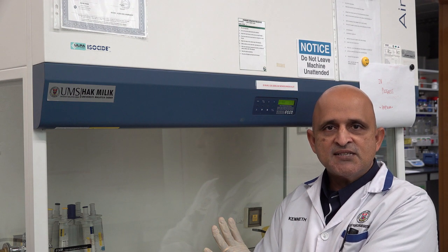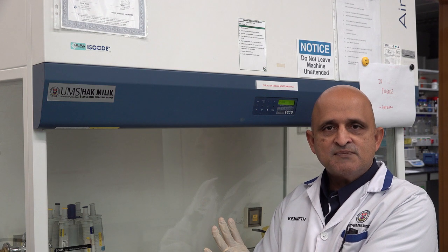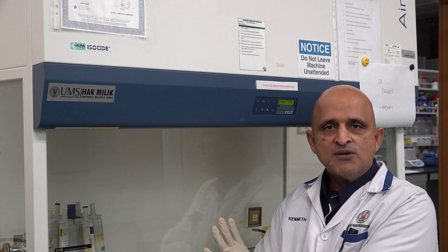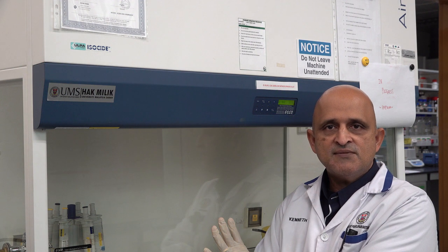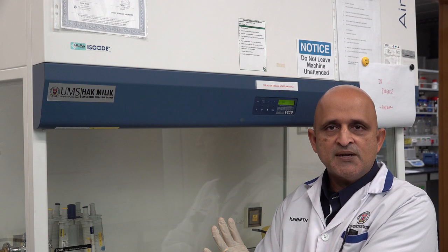A biological safety cabinet must be utilized in accordance with the standard operating procedure in order to achieve a safe and cohesive working environment.